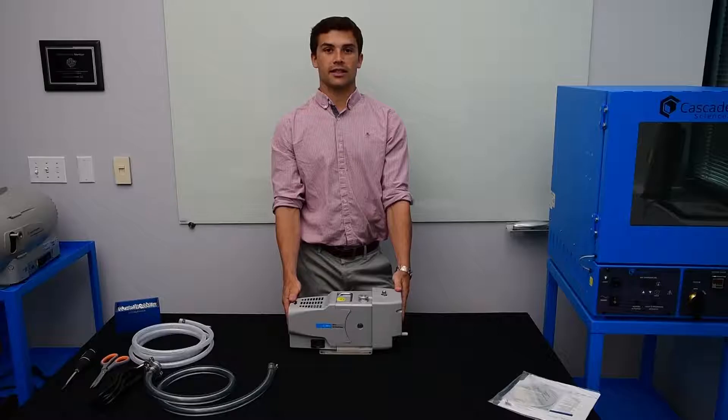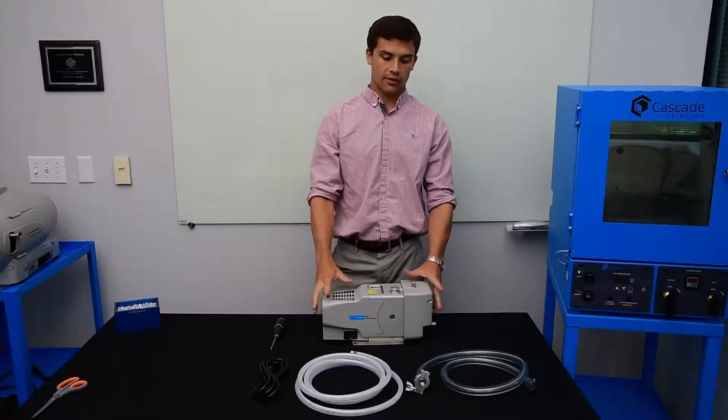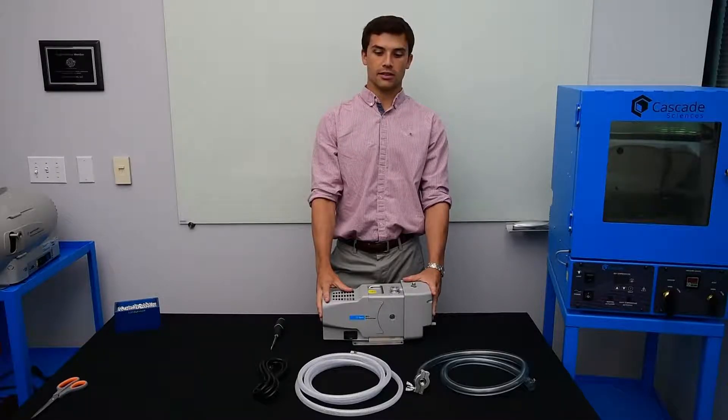And now we'll go to the installation. Alright, and now that we've unboxed the pump we're ready to start with installation.